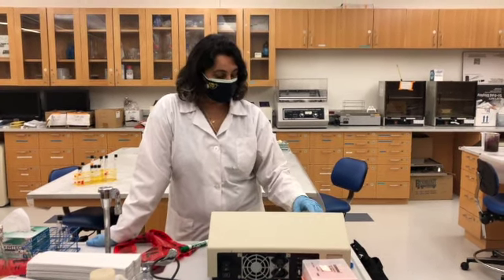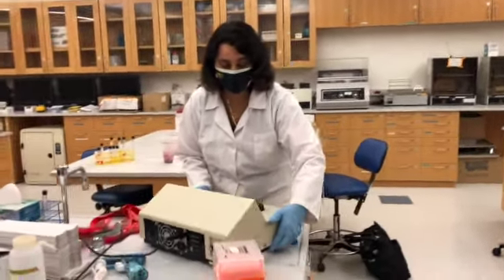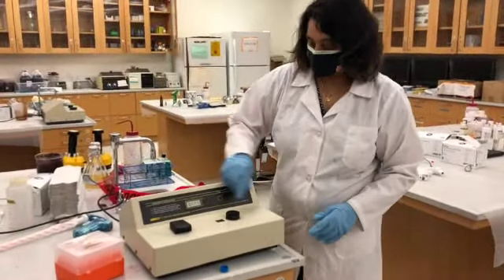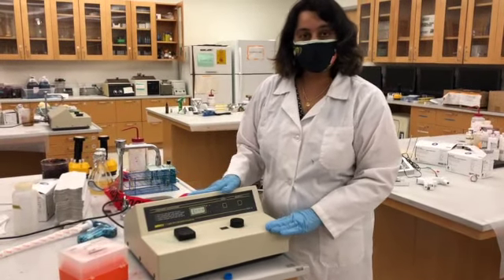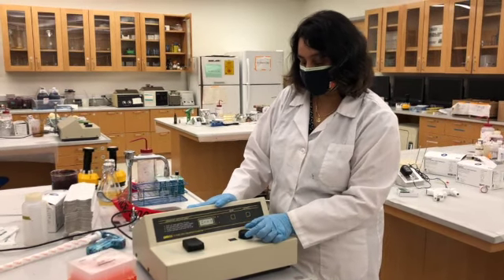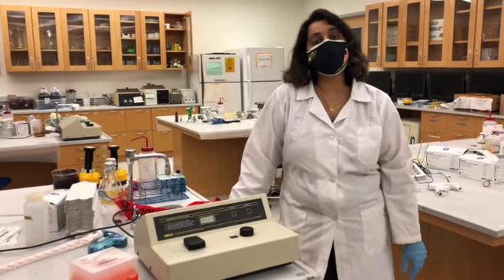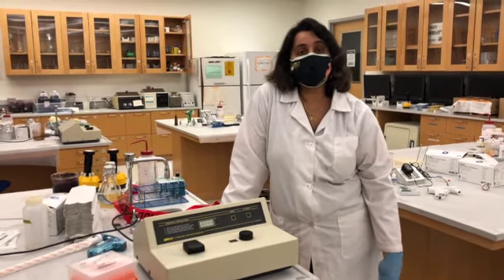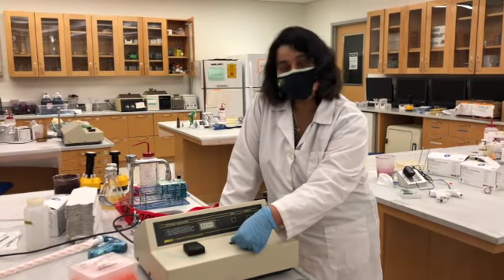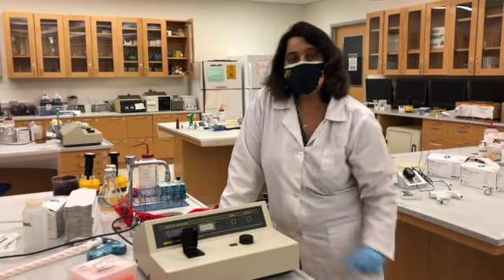So you have the spectrophotometer here, and I'm going to demo how to use this machine. It's a very small, simple instrument. You can set the wavelength of the visible light, or any other light if you want to use, using the circular knob that is right here. For bacteria, we know that the bacterial cells absorb the most in the visible range, which is 600 nanometers. So I set the wavelength to 600 nanometers.